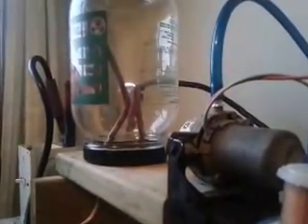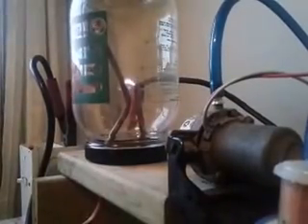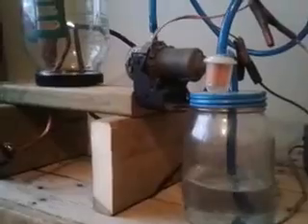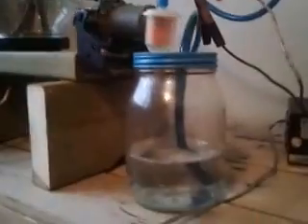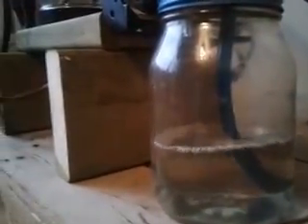You can see it's moving quite a lot of air, and when it kicks on you'll see the arc starts to move as the air flows through the arc chamber, which is kind of cool. It also maybe gives the nitrogen a little bit of time to react. I decided to go the vacuum route instead of with an air pump.